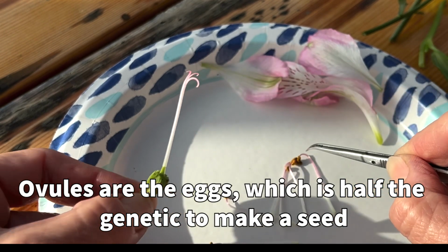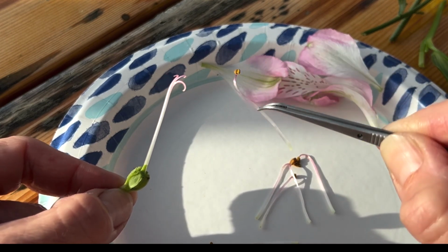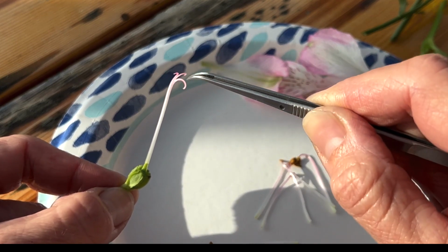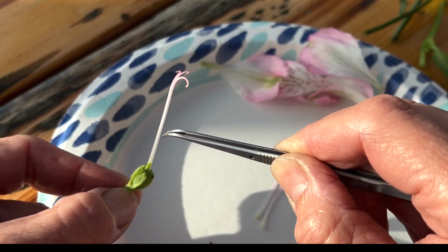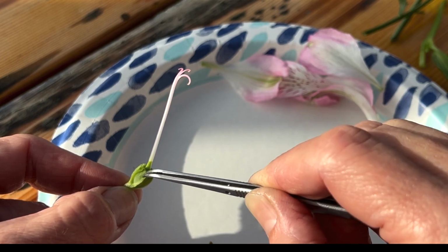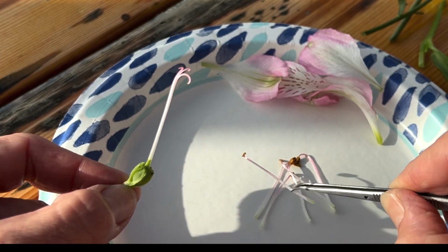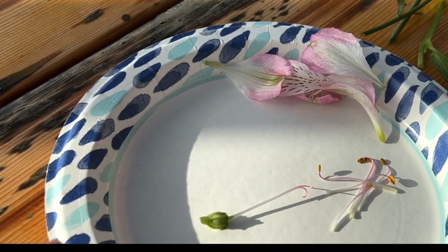What happens is that pollen from another flower will come and touch the sticky stigma, and then this sticky stigma will send down a pollen tube down this style, and send that genetic information, that DNA, into one of these ovules. So I'm going to open up these ovules right here and we'll see what's on the inside.